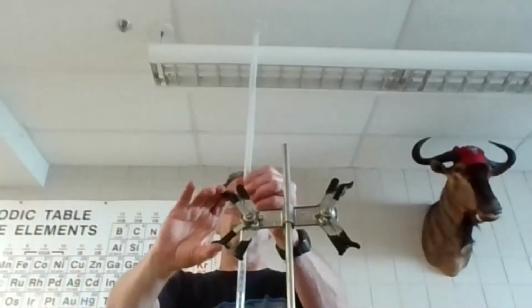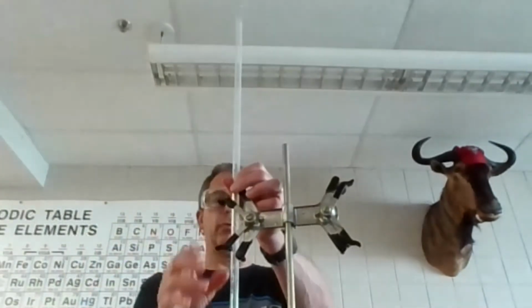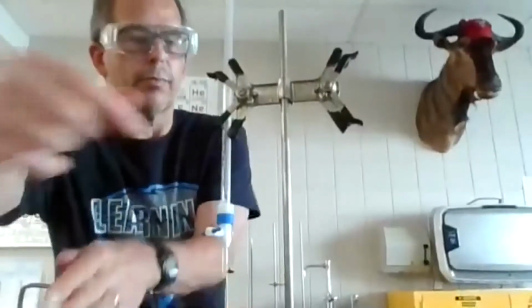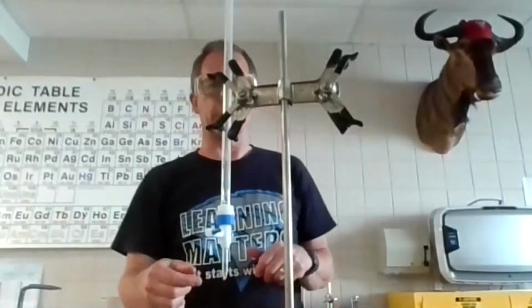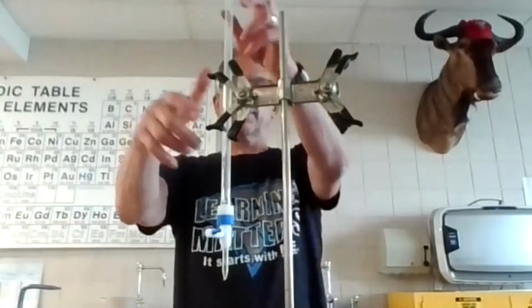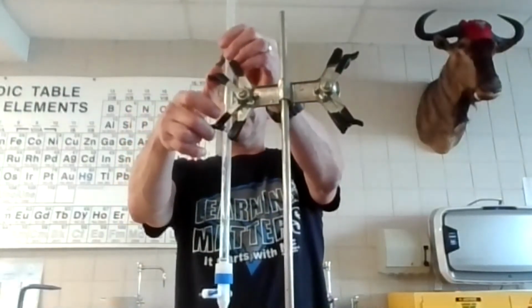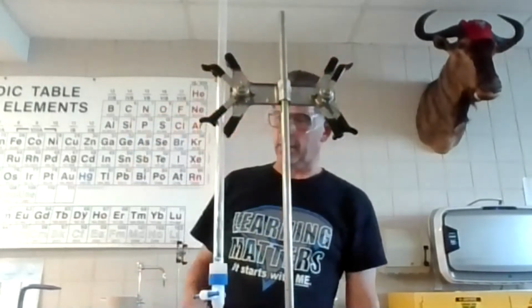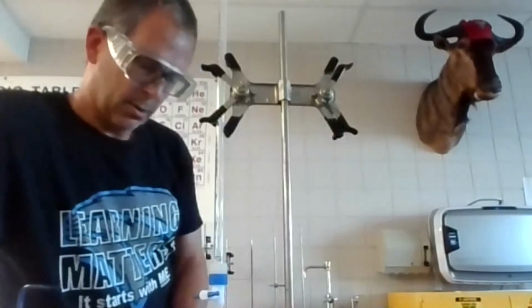Okay, sometimes you get a little puddle down there. You got to knock it through with some pressure. If you get a little water at the bottom of this, I don't know if you can see that right there. If you get a little water back in there, but this one looks pretty clean or pretty good right there. Okay, this one's kind of a really fast burette, so it's less likely to pool up. The opening is pretty large with that. Okay, let me just wipe up this base that I dropped over here.